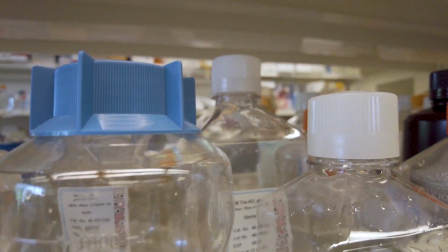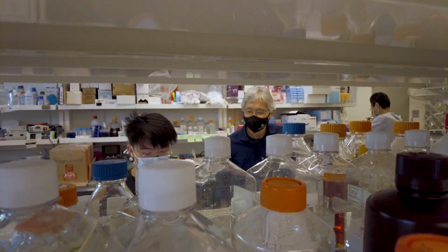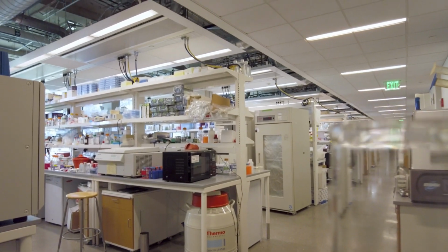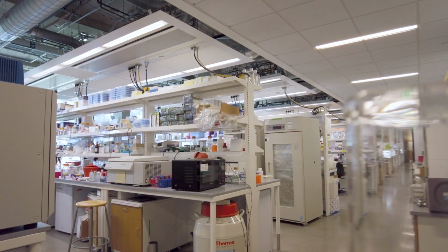In order to really either do drug design or screen for drugs in an unbiased manner, it really is almost essential to have knowledge of the atomic structure of these protein complexes. That's the reason why CryoEM is so important to us: it fulfills both the thirst for fundamental knowledge, but also allows us to think about practical applications to be able to manipulate these enzymes for patient care.